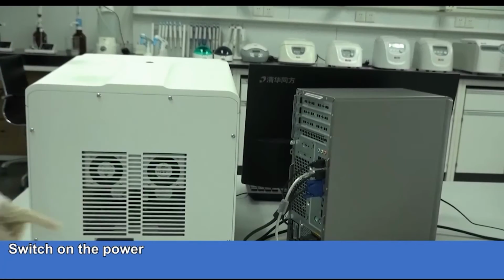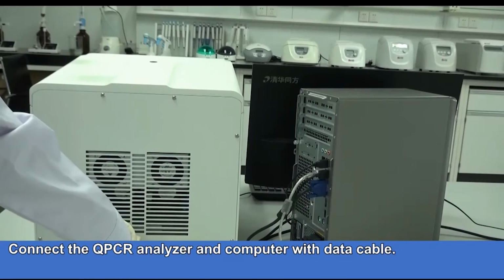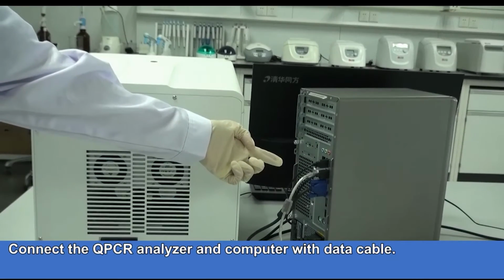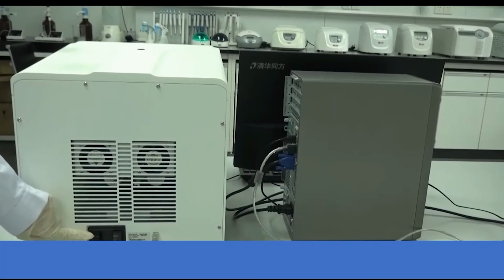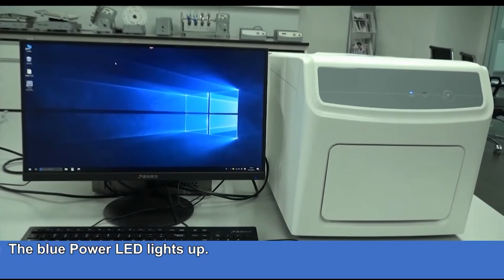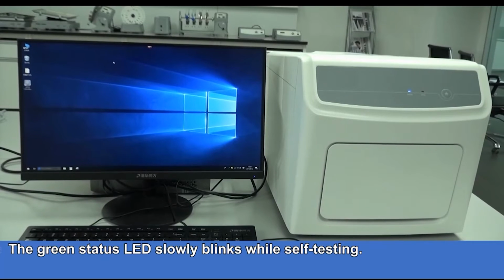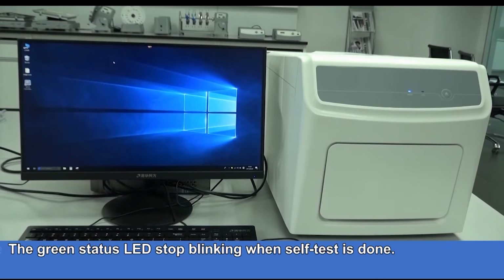Switch on the power. Connect the analyzer and computer with data cable. Press the power button on the analyzer to start up. The blue power LED lights up. The green status LED slowly blinks while self-testing. The green status LED stops blinking when self-test is done.